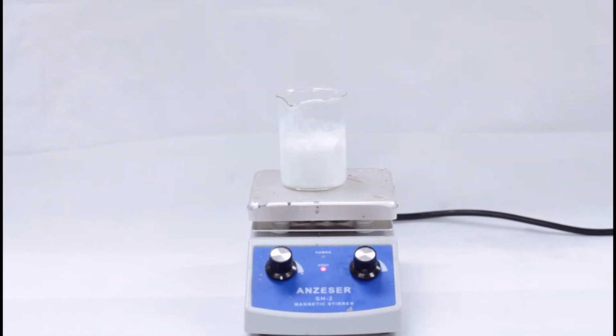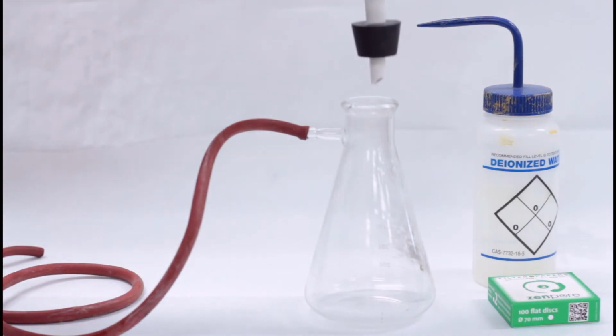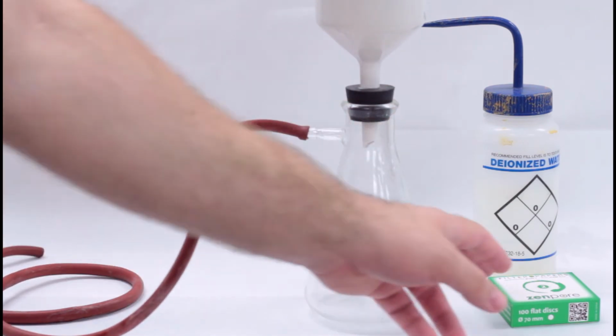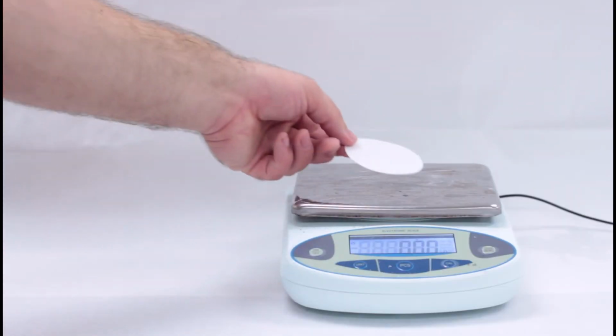Heat the precipitate for about 10 minutes, placing a watch glass over the beaker so that no splatter occurs. We are heating the precipitate to increase the grain size of the solid so that it does not clog our filter. While the precipitate is heating, set up the Buchner funnel on the filter flask and weigh the filter paper. We will need to subtract the weight of the filter paper from our final product once we're ready.